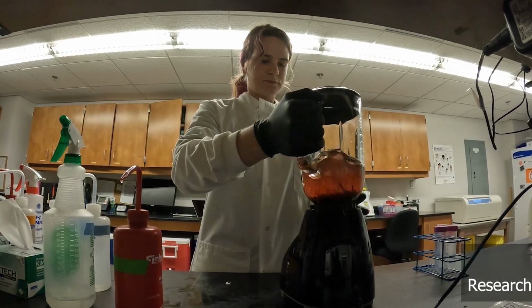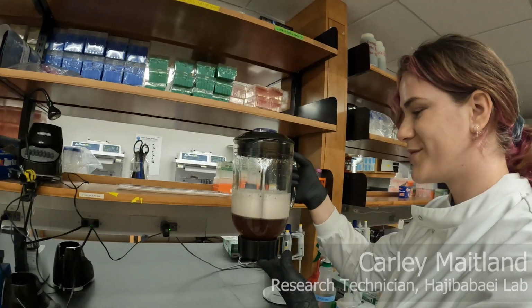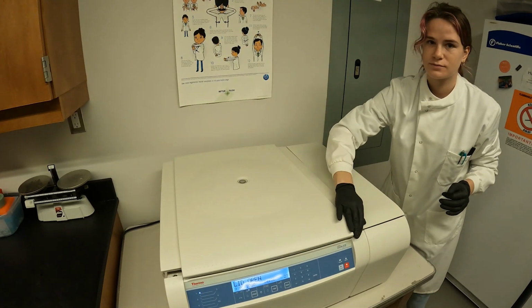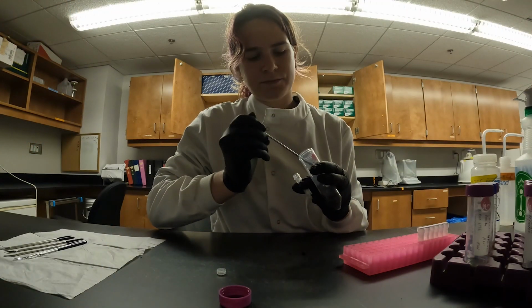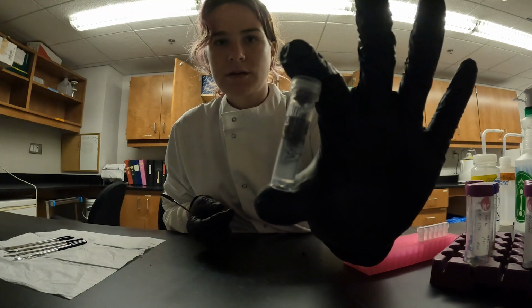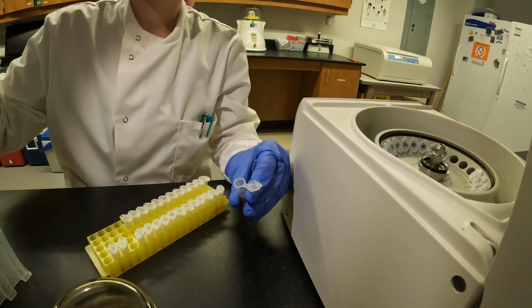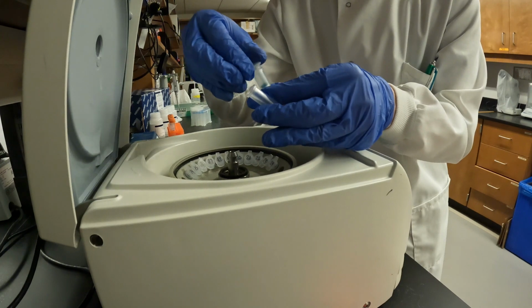We start with a preserved benthic sample and blend the contents to make a mixed slurry. Once homogenized, we condense the slurry through centrifugation. This prepares the DNA for extraction by pouring off and evaporating the preservative. We transfer a small portion into extraction bead tubes, where it's combined with lysis reagent to break apart the cells and release the DNA. That's when DNA within the lysate can be isolated through an extraction process that removes inhibitors for downstream processes.